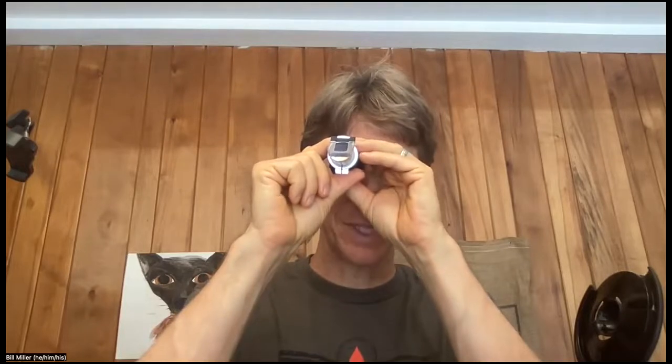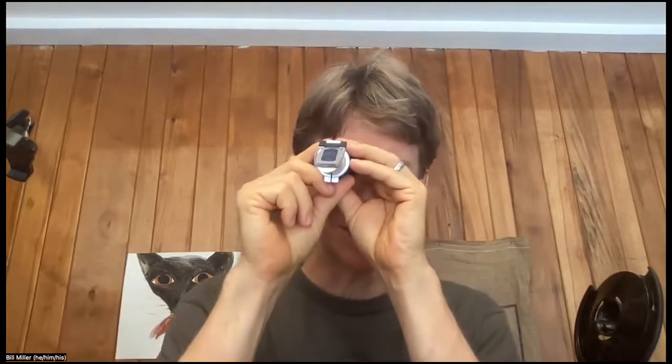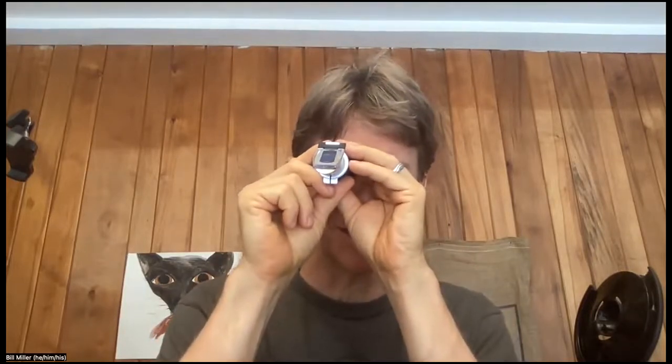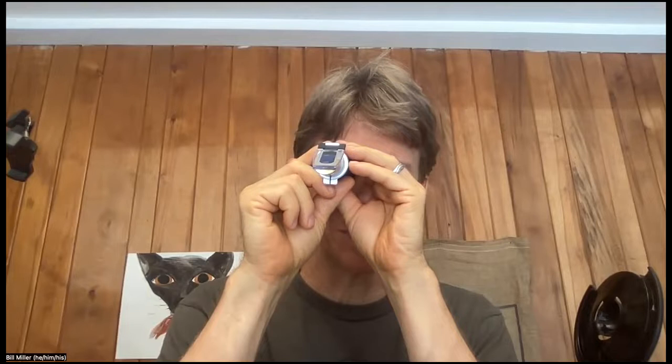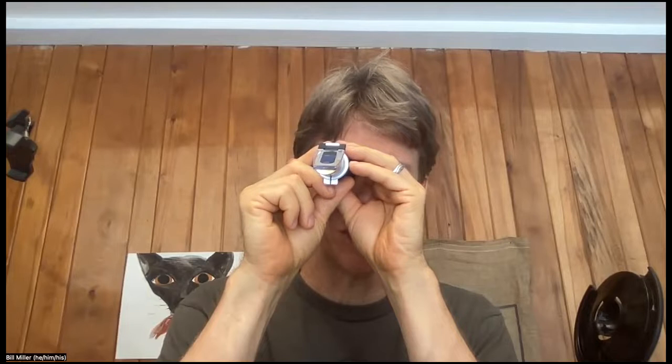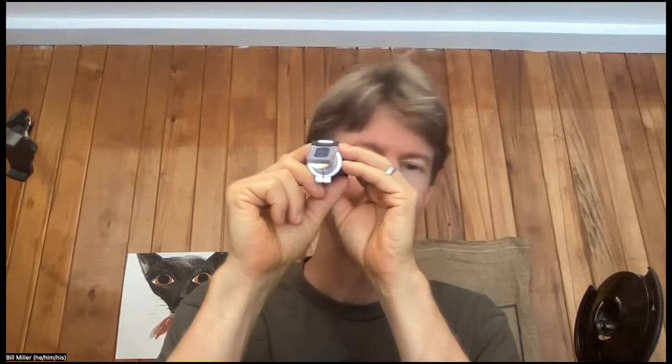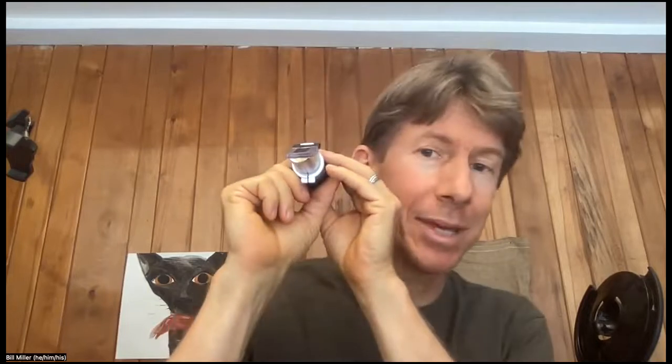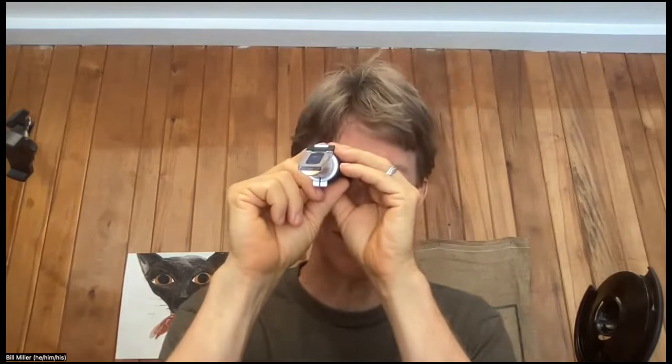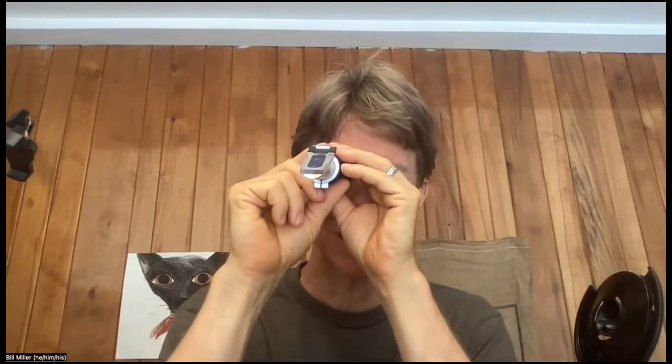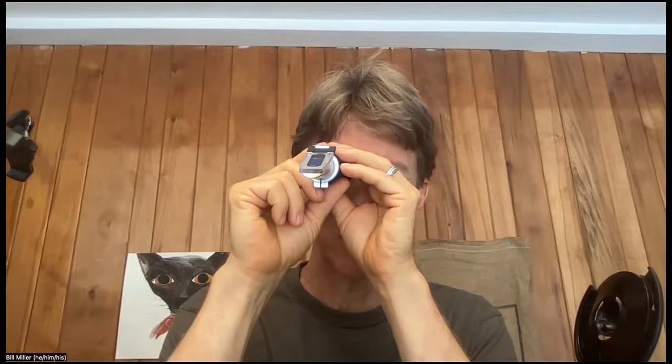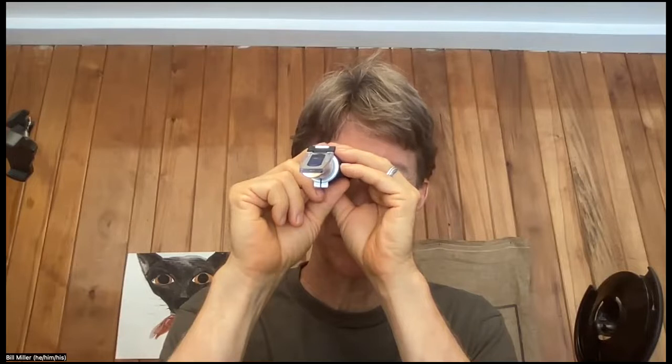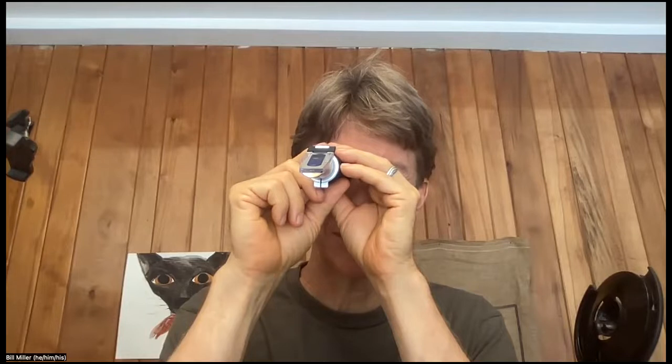And then I'm going to look at this and I'm going to estimate it. And the line is very sharp now, so that's good. So I can estimate it even better. I'm going to estimate this at 1.3450, and let me write that down.